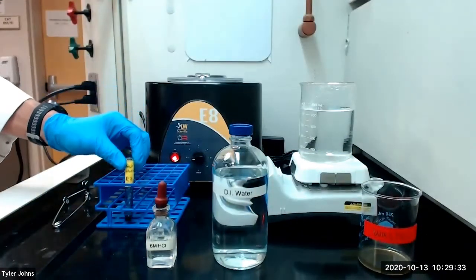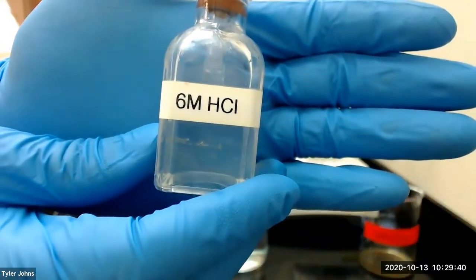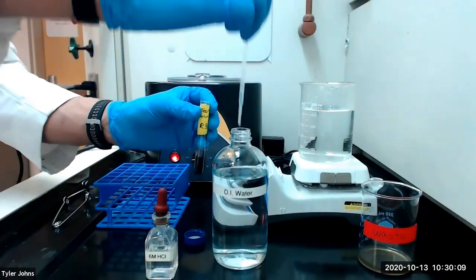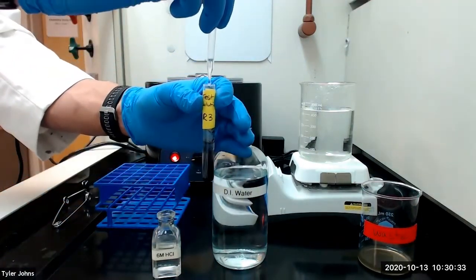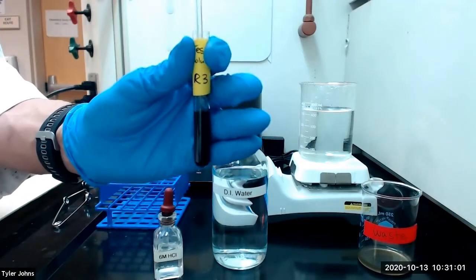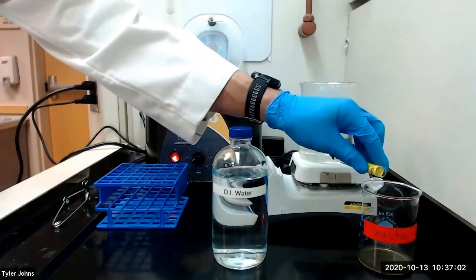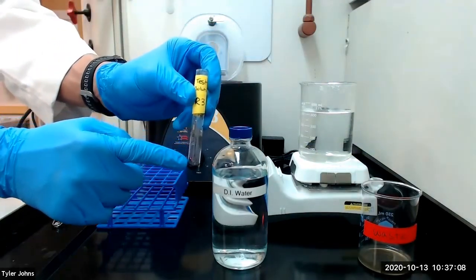To R3 we're going to add 4 milliliters of deionized water and 4 drops of 6 molar hydrochloric acid. We will then stir thoroughly and centrifuge. After centrifugation we can discard our wash solution. Make sure to save residue R3.